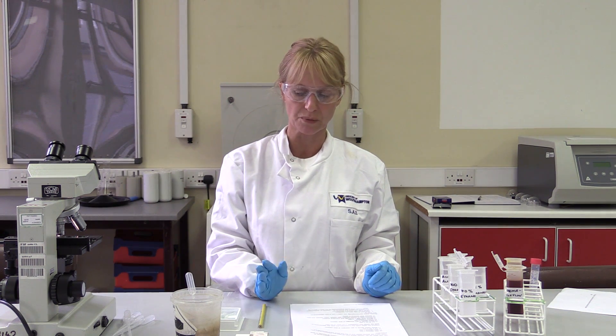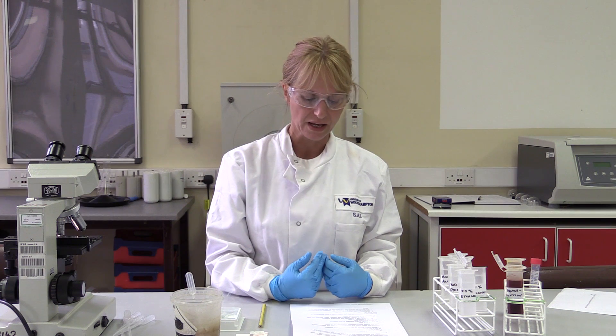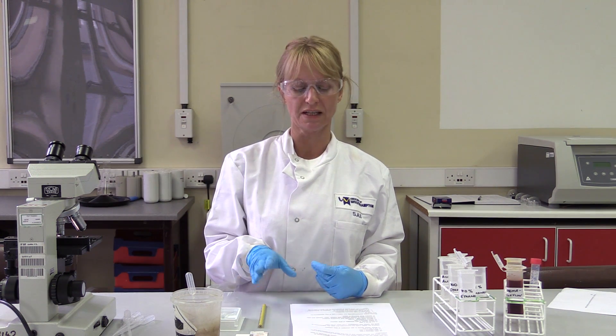Going through each staining process in turn — where it says wash in tap water, use tap water; if it says distilled water, use the bottle of distilled water provided. Once you've completed the staining, you'll put a cover slip on the slide in the fume cabinet, because as you'll have read in the COSHH regulations, the mounting medium isn't something you want to inhale. Do the clearing in xylene substitute and the mounting with the cover slip in the fume hood. Once dried sufficiently and no longer giving off fumes, look again down the microscope and comment on your slide. Hopefully it will be stained properly and you can diagnose whether there are normal or abnormal cells in the sample.